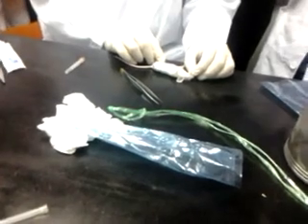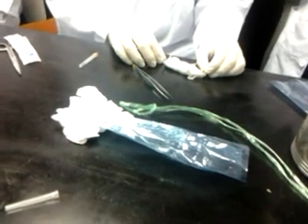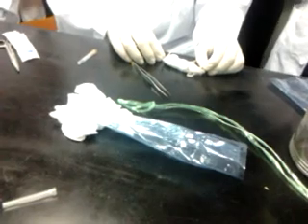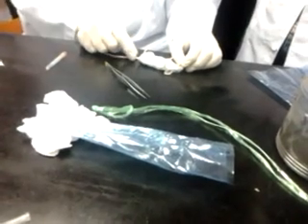If you use the cocktail, the mixture, the survival rate is better. You hold this way so that they can breathe well. This is called resuscitation. Once you anesthetize this way, you have to remove the animal immediately and pull the tongue. Then take them outside and let them breathe.